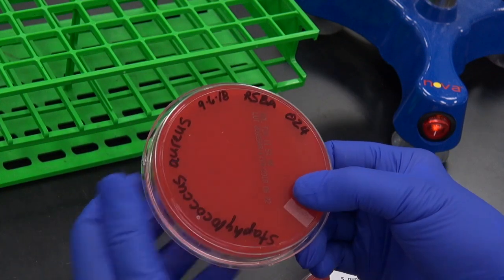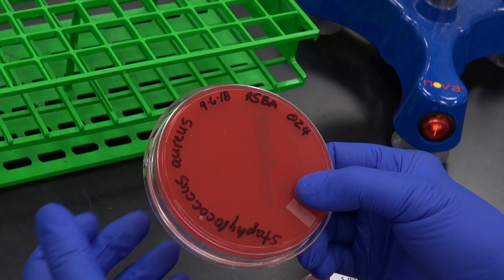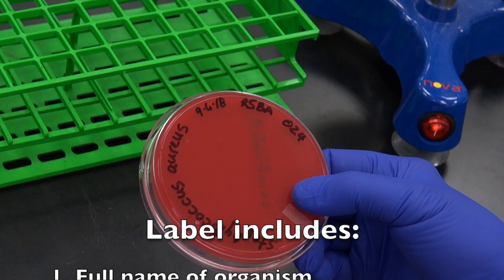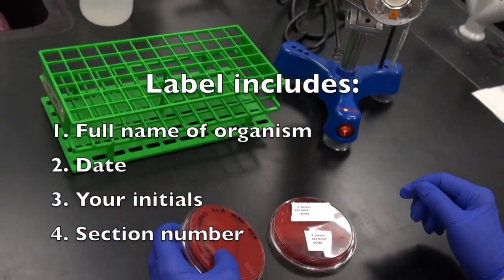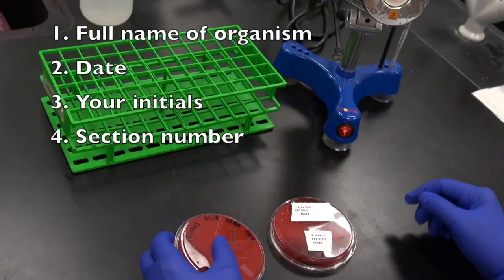Plates are always labeled on the agar side not the lid side. We will keep both plates lid side down, agar side up, on the bench as we work.